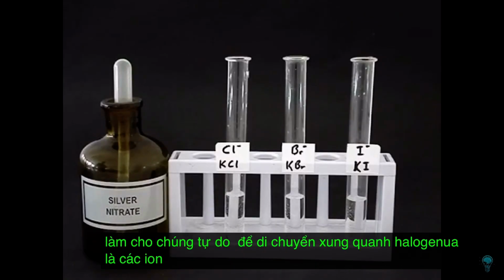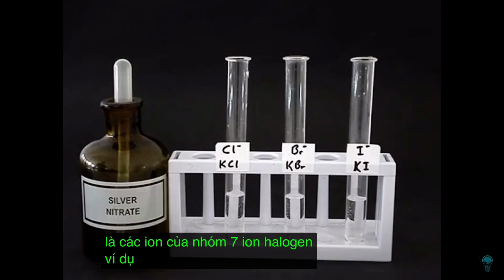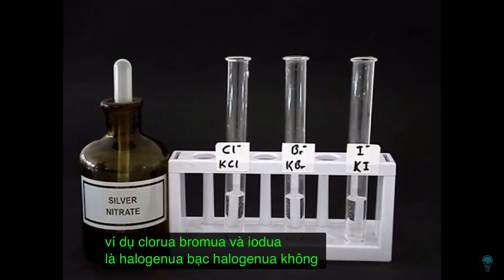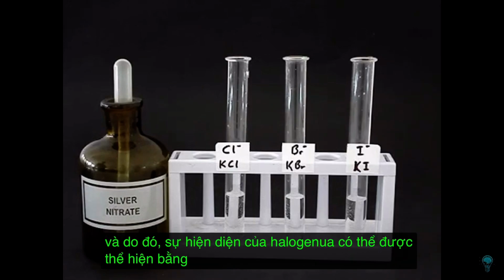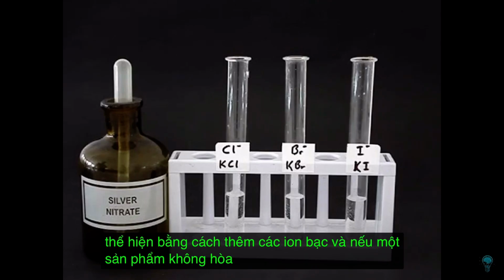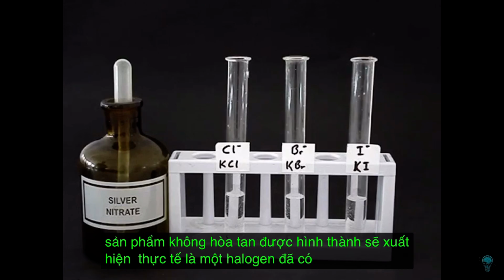Halides are ions of group 7, ions of halogens. For example, chloride, bromide and iodide are halides. Silver halides are insoluble, and so the presence of a halide can be shown up by adding silver ions, and if an insoluble product is formed, that shows up the fact that a halide was present.